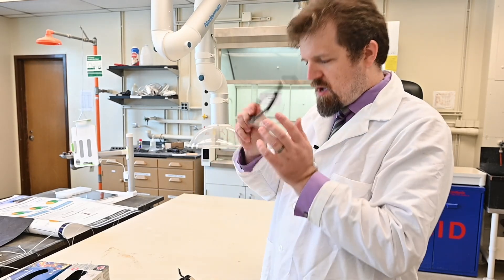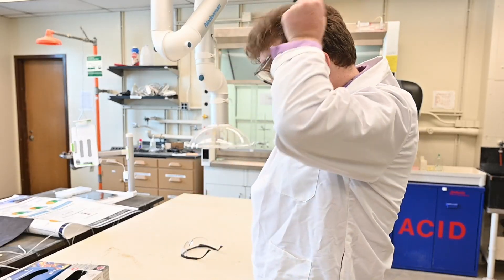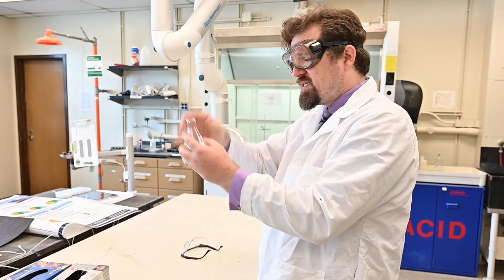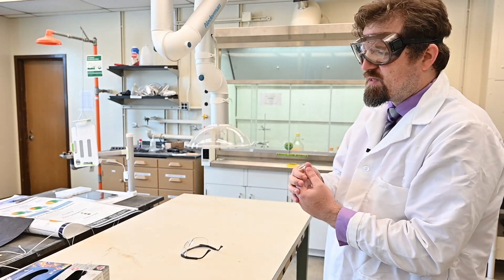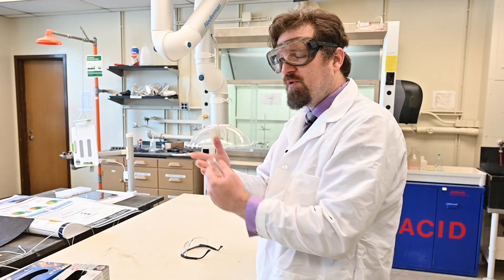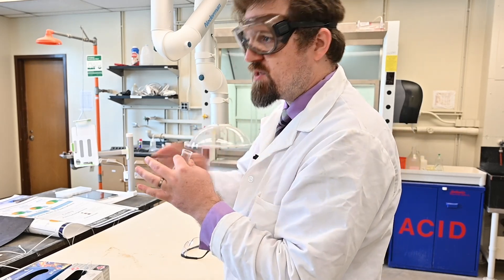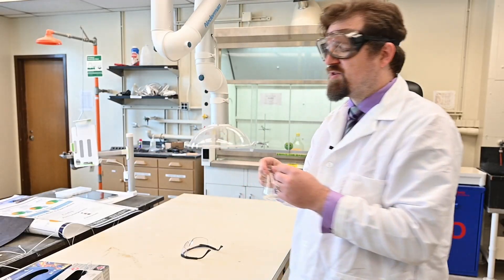First, don your safety goggles — as always. When you have an object, usually a flask or a test tube, and you're trying to smell something — and some labs do have you smell things — there is an appropriate way to do that. What you don't want to do is go full bore on it. If you get really close and angle it towards you, a strong enough hit of that could cause damage to your respiratory system.